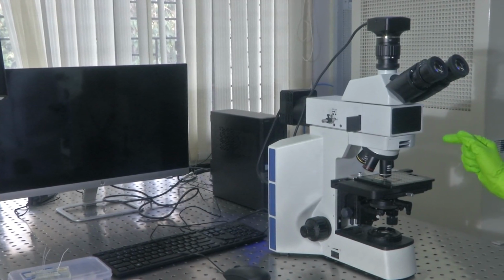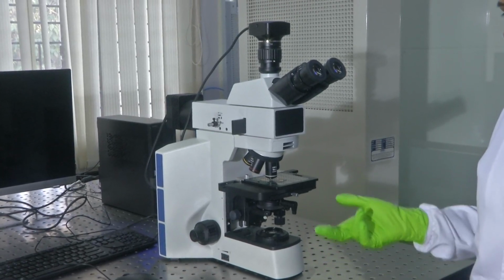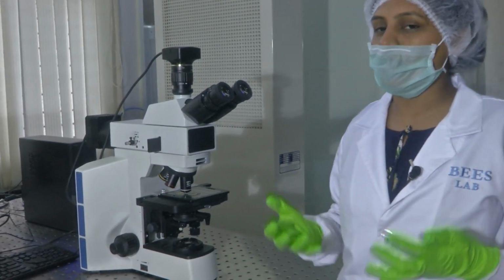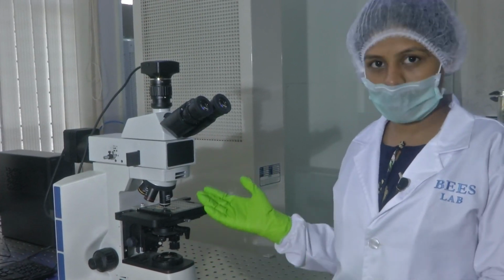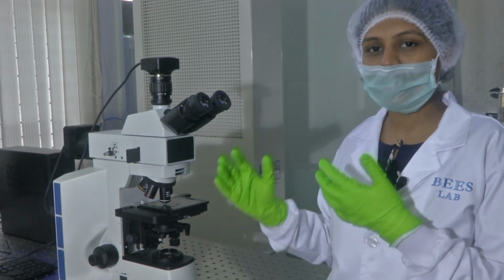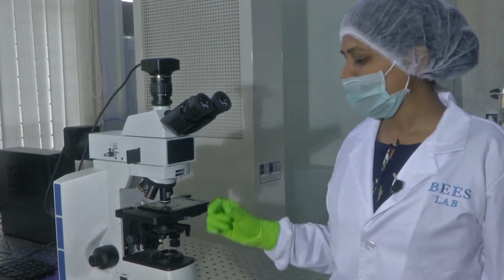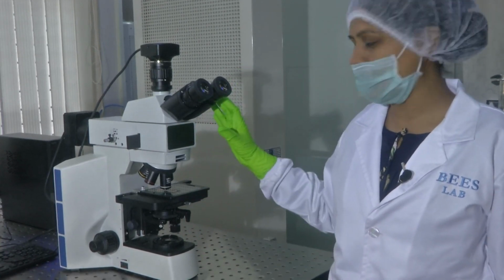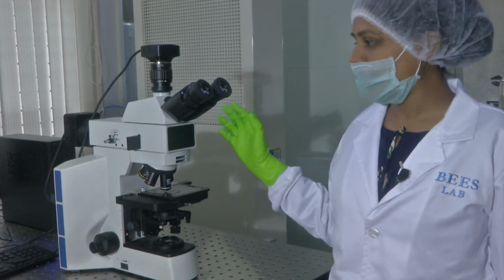Now, let us take an opaque sample, in the sense the wafer designs. Earlier we had to view the 3D image of the device, hence we used the microfluidic device, and you could understand how the depth perception could be deciphered using a stereo microscope. So, now how do we understand the importance of this? Say I am using a metallurgical microscope, you should not be using a tissue sample with this. It is dedicatedly designed to study an opaque sample. So, let us take one of the devices which has been fabricated, put it under this, shine light, adjust the magnification, thoroughly focus it and see how the features could be viewed through the monitor using this microscope.